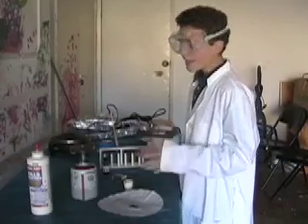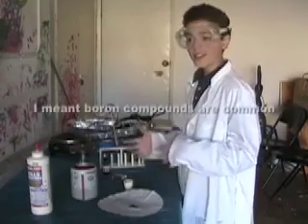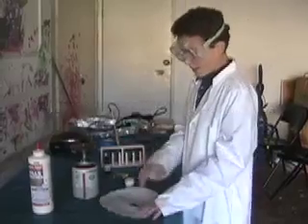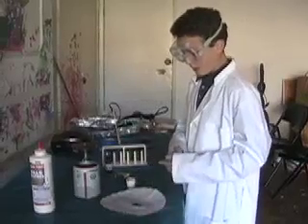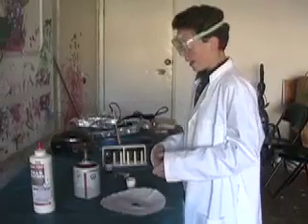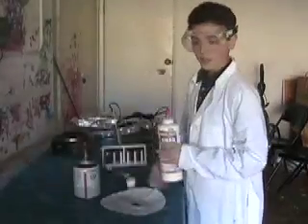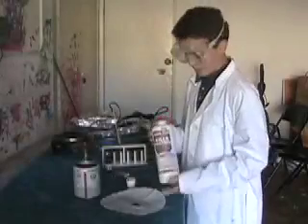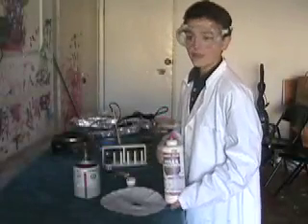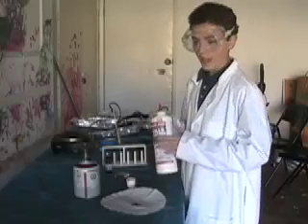So boron and its compounds are pretty common and pretty cheap, but actually not many people have seen elemental boron. I would like to thank Mr. Home Scientist, another YouTuber, for giving me the method for isolating elemental boron from boric acid.